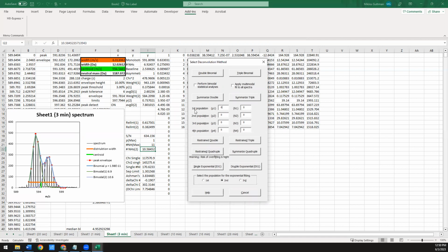labeling probability of 0.375 and a number of amides of 6.9. And population 2 is 0.737 with 10.58 as the number of amides. I can now say, okay, do a restrained double fit where it'll keep these constant, but only vary the relative intensity of each population. All right, restrained double. And I'm basically just testing this on that same data set and see how it behaves.